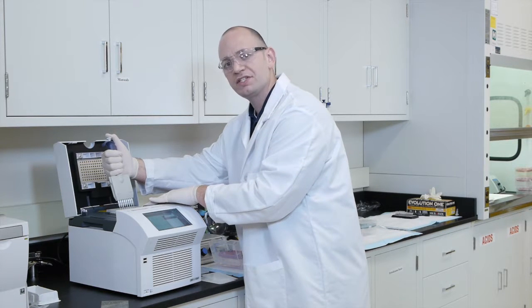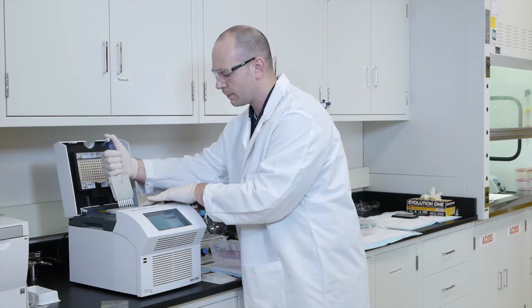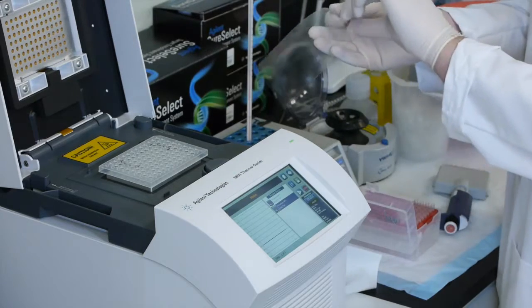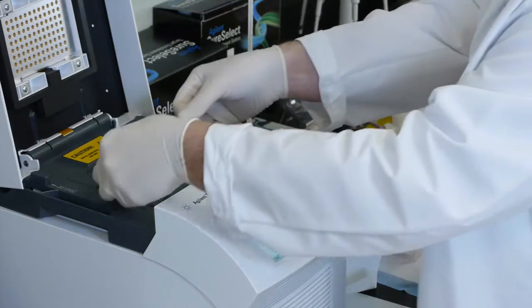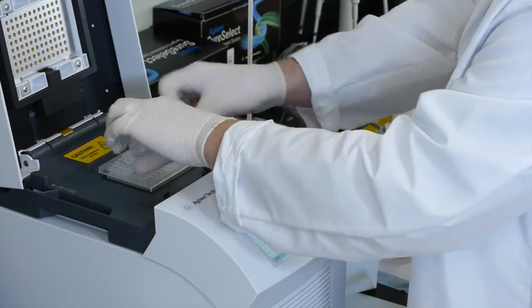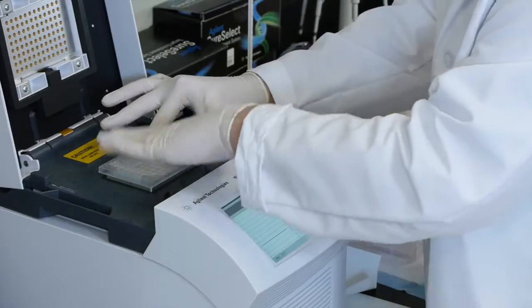So you want to be very quick and get your first seal tightly in place over the samples. As you can see, I've outlined the sample area that I was working in with brackets using a black marker just to help guide me. This is a nice trick.